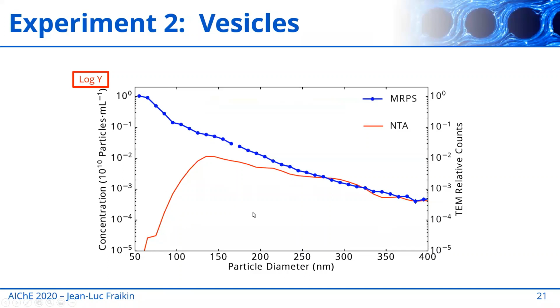So what's going on here? Well, we need an adjudicator. So let's measure this sample by EM. And you can see here the counts using TEM continue to increase monotonically all the way down to 50 nanometers and beyond. And so this is the gold standard, and we see that the MRPS measurements agree very well with the TEM measurements, and the NTA signal does not. So how can we understand this?